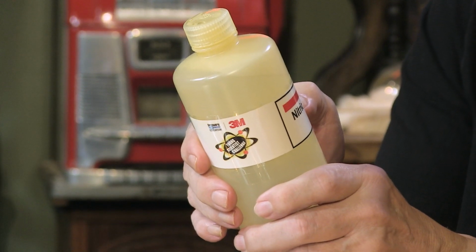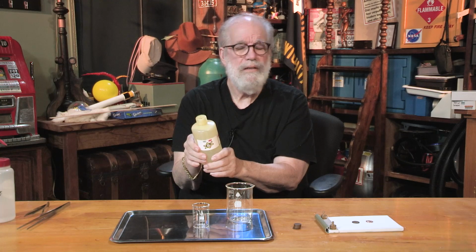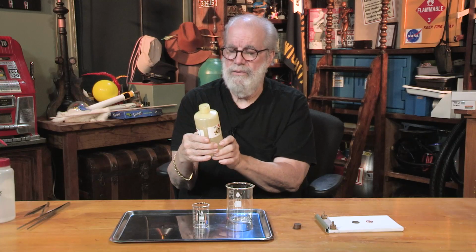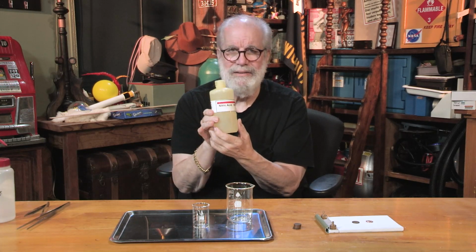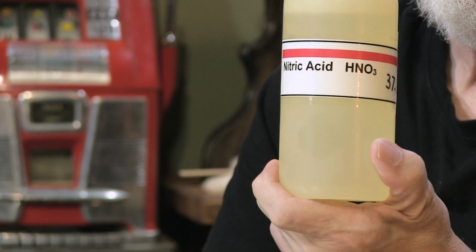And it's got its formula on the outside, H. See, H is hydrogen. N, nitrogen. Hydrogen and nitrogen, that can't be too complicated. And then oxygen, HNO3. It says right, oh, nitric acid. Can you believe that? The meanest acid on the shelf is made out of three harmless little guys hooked together. This is mean stuff.